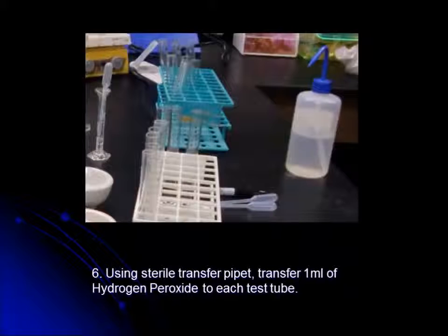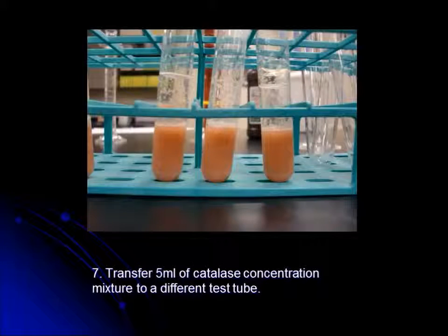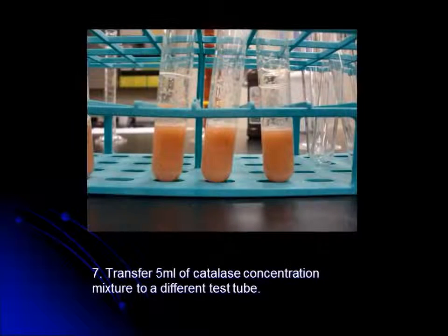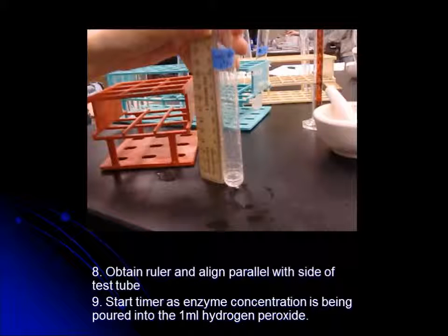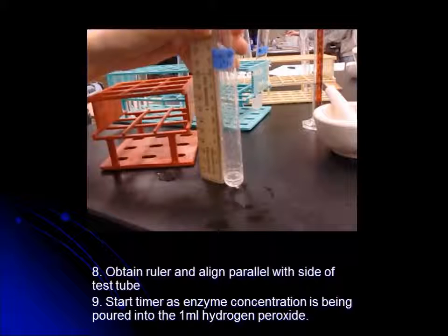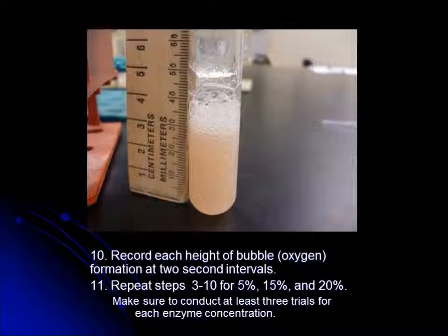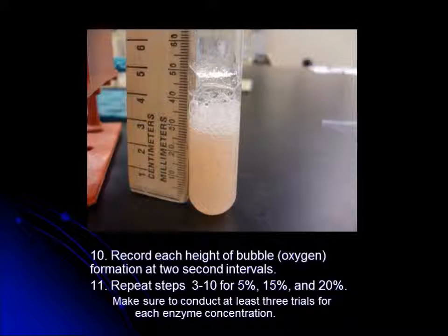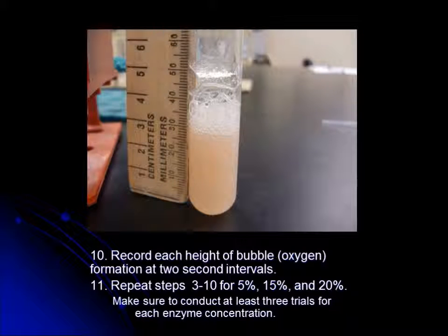Step 6: Using a sterile transfer pipette, transfer 1 mL of hydrogen peroxide to each test tube. Step 7: Transfer 5 mL of catalase concentration mixture to a different test tube. Step 8: Obtain a ruler and line it parallel with the side of the test tube. Step 9: Start the timer as enzyme concentration is being poured into the 1 mL of hydrogen peroxide. Step 10: Record the height of bubble formation at 2-second intervals. Step 11: Repeat steps 3 to 10 for 5%, 15%, and 20%, conducting at least 3 trials for each enzyme concentration.